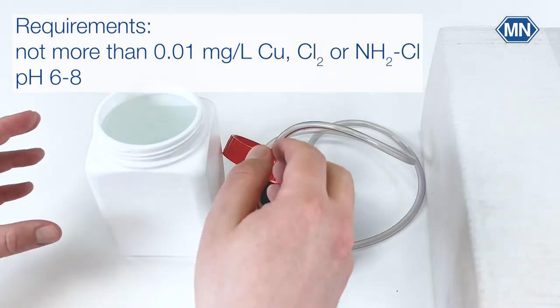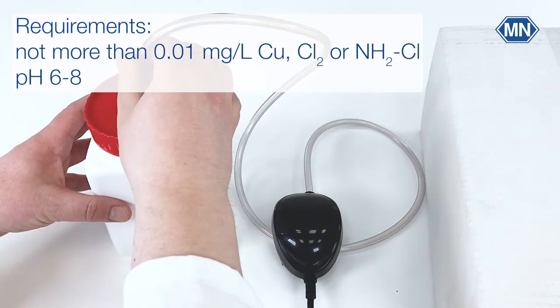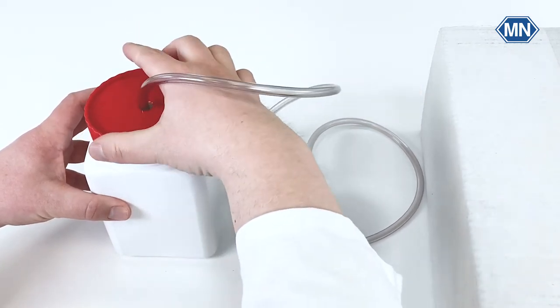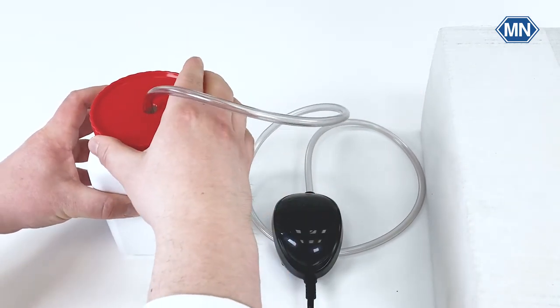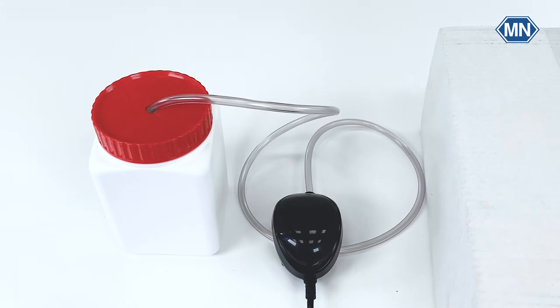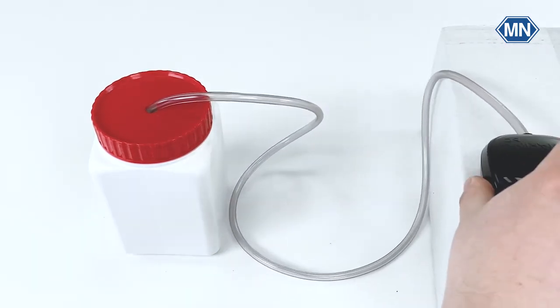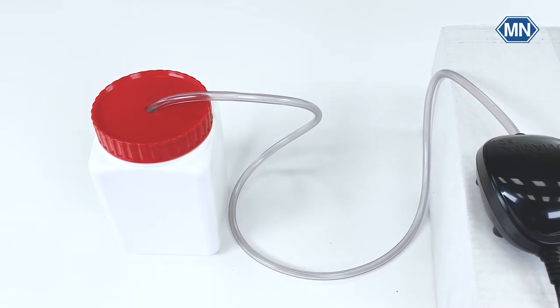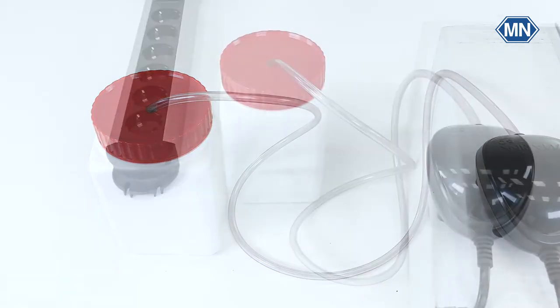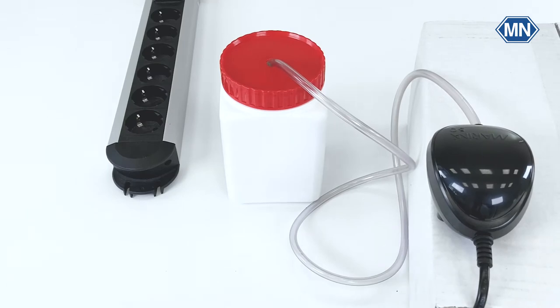Close the lid of the storage vessel firmly. Be sure to position the pump always above the water level. Otherwise water may flow back and damage the pump. Plug in the pump to the mains.